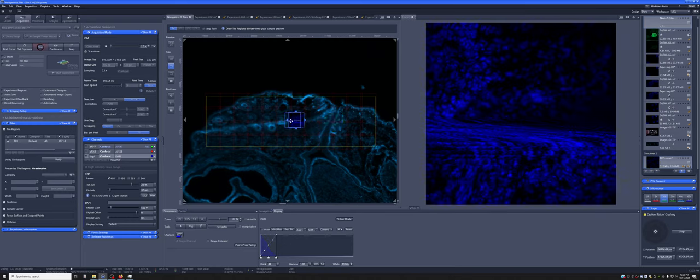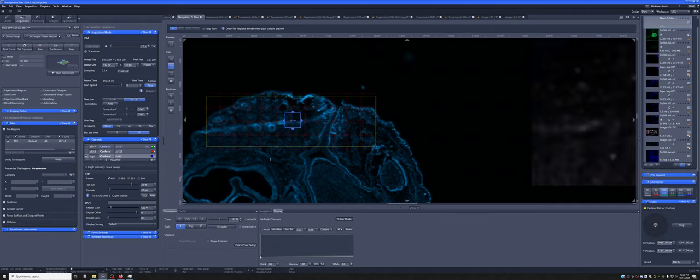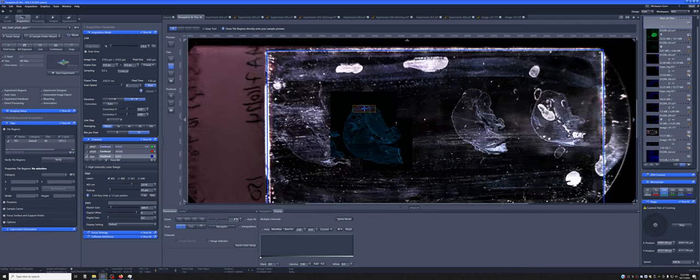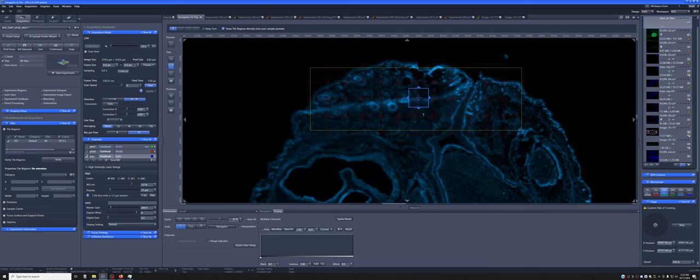So if you were to take a tile of this, you would only see a small portion in the middle in proper focus. So what do you do when you're in a situation like that? There are things that you can do to try and not have the slide be tilted, but if you have a cover slip that extends all the way to the edge, that is not something that you can typically solve after the sample has been prepared.